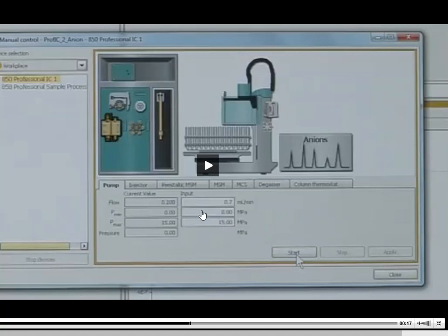The flow rate, though, I don't want to wait forever for the flow to come through. I normally crank this up to about 2 mL a minute. I let the pump work a little bit harder. It's not going to go through my column, so I'm not going to build up tons of pressure. I've got this purge valve that's opened, and I don't really want to wait and wait for 0.7 mL a minute. So I normally change this to a 2, and this to a 0. Don't touch that one. And then I hit the start. And that allows your purge flow to begin.